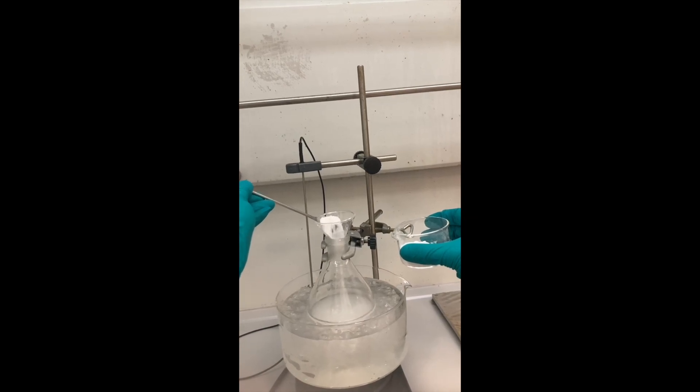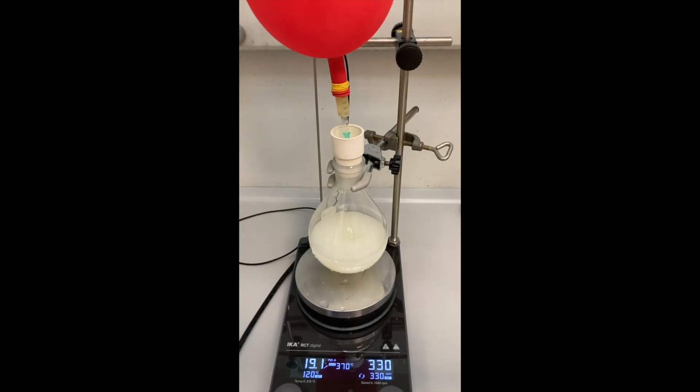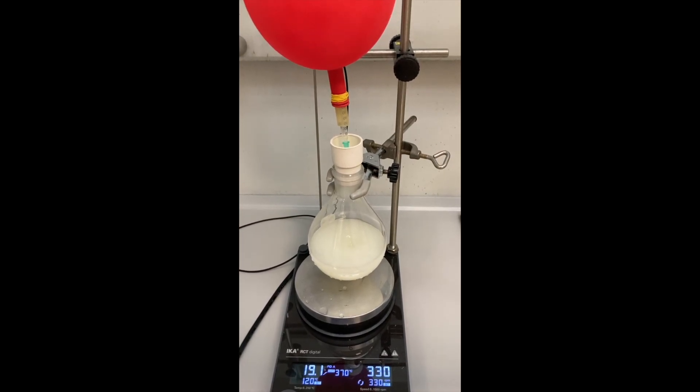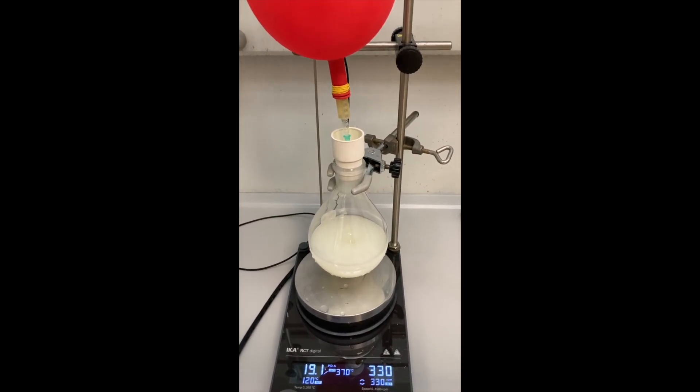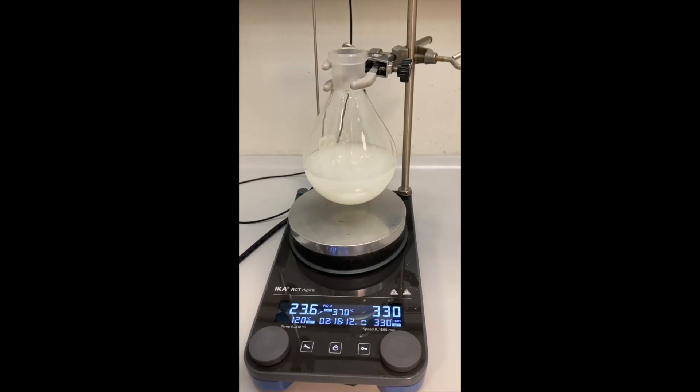After adding all the oxidizing agent, I removed the ice water bath and let the reaction mixture stir at room temperature for two more hours. After that time, the TLC plate showed complete consumption of the starting material.